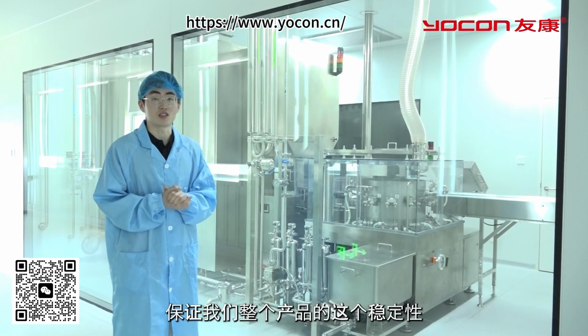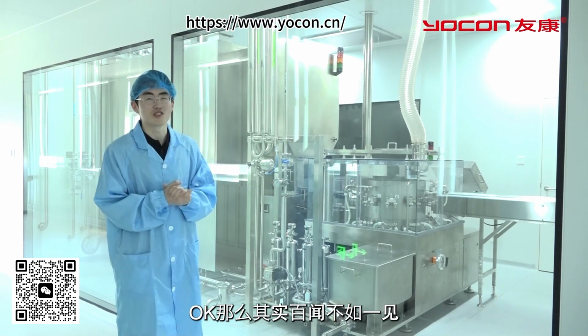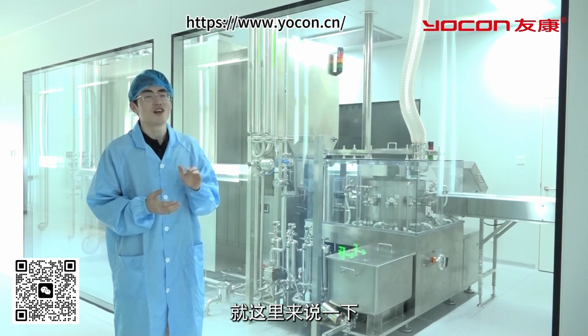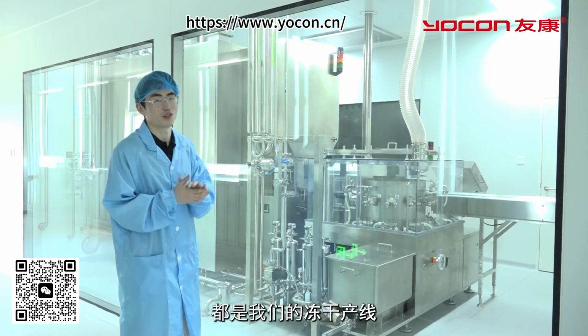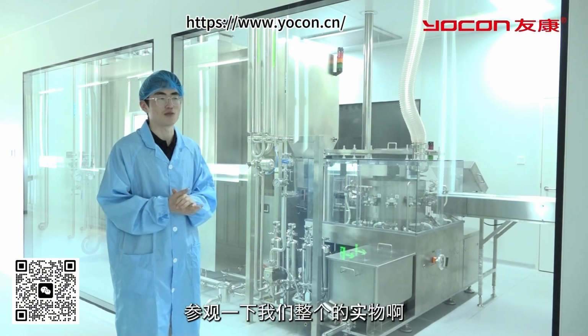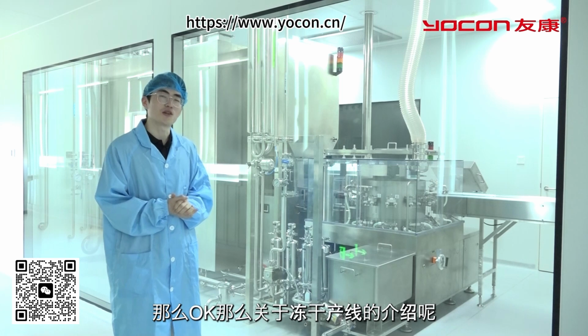Well, seeing is believing, and it might be difficult to appreciate the scale of our entire production line through this video. In fact, we have 4 rooms dedicated to our freeze-drying production line. So, I hope you'll have the opportunity to visit our facility in Miyun someday. That's all for the introduction to our freeze-drying production line.